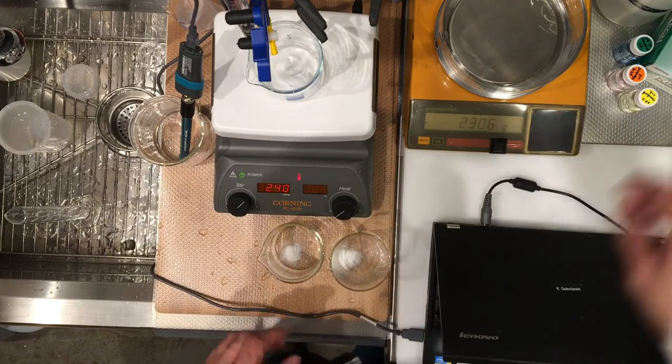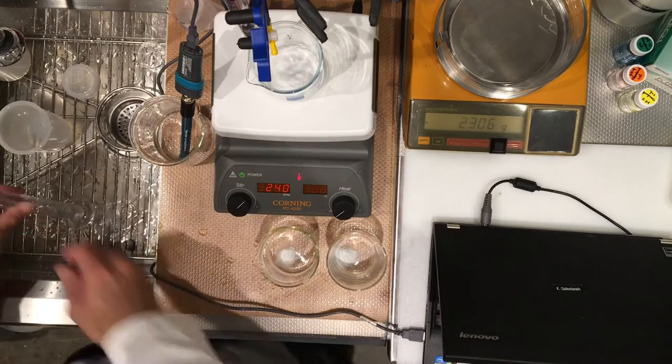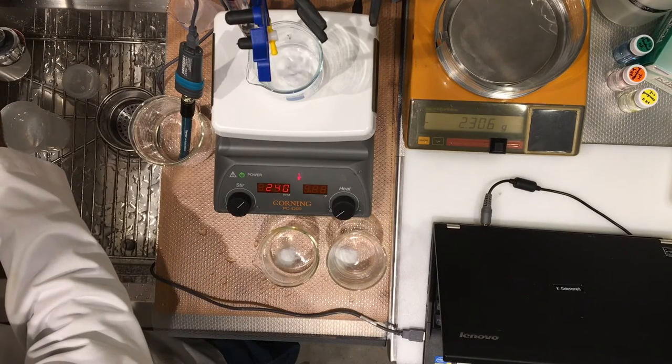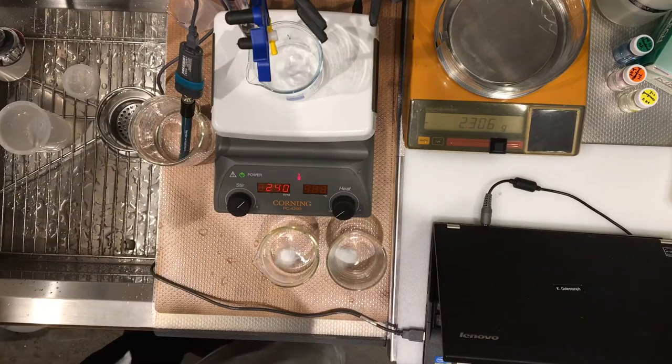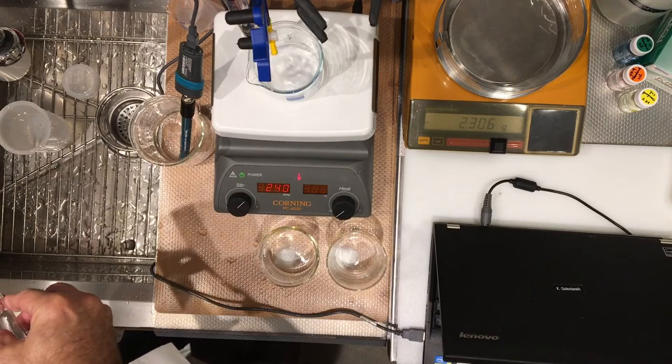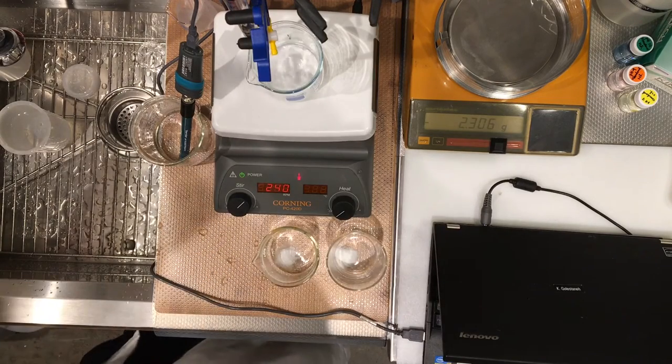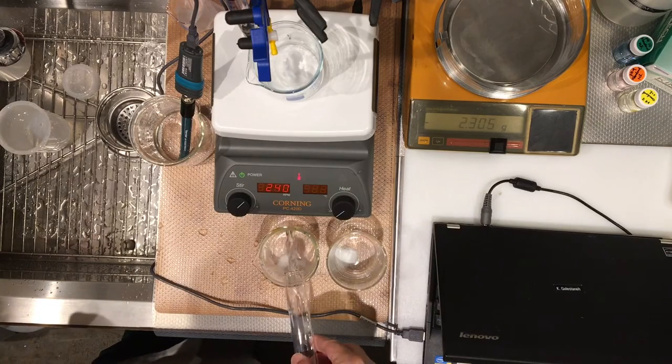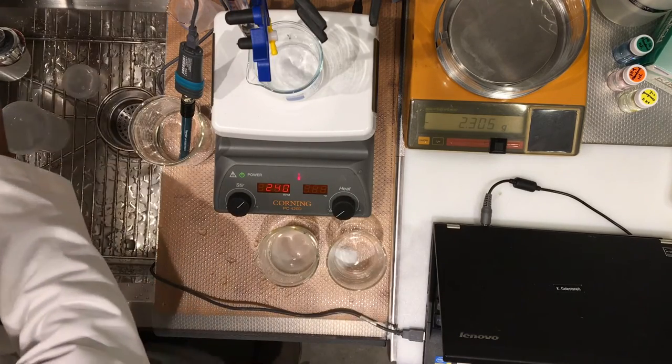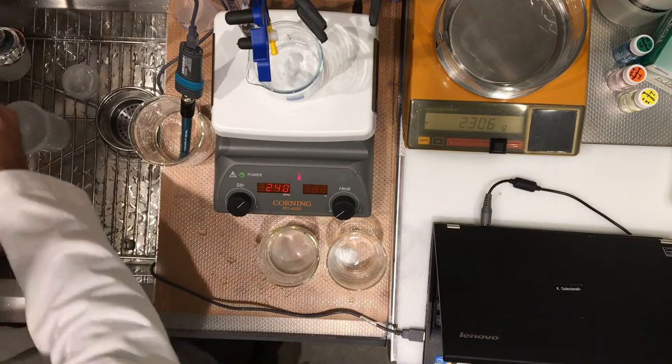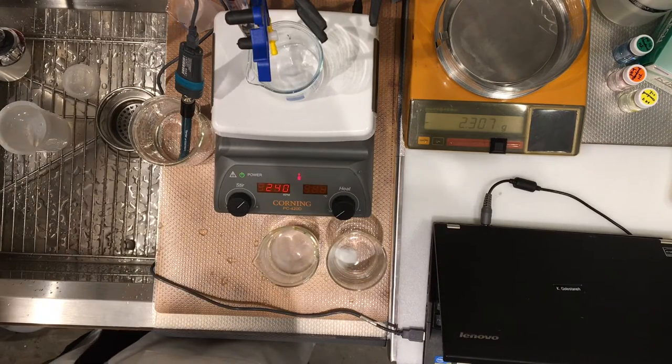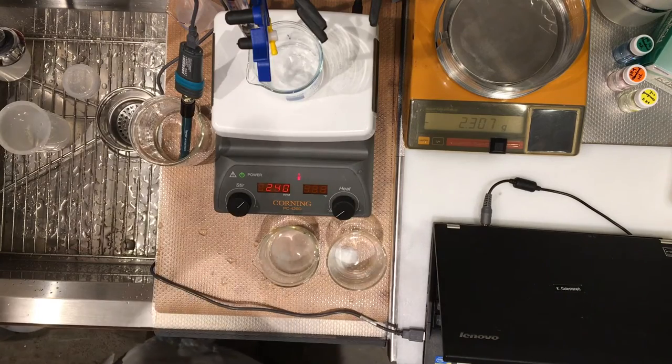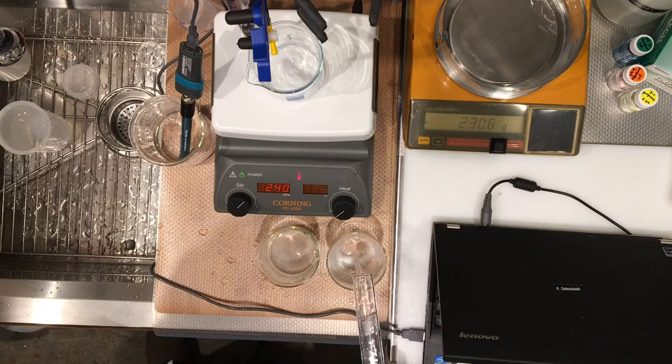All right, so we've done with these samples, so now let's put water into the next two samples, so we can help them dissolve faster. All right, this is my second one. This is my third one.